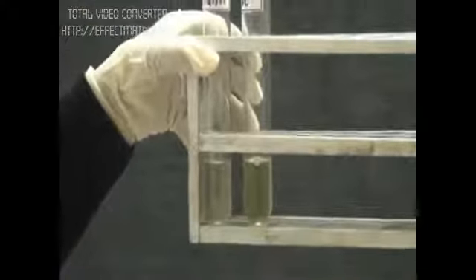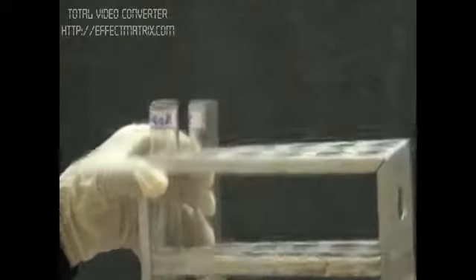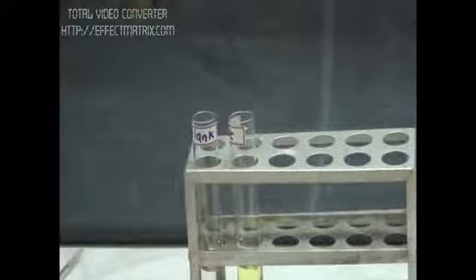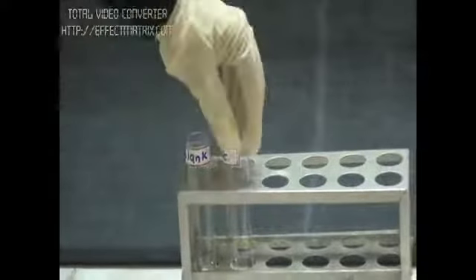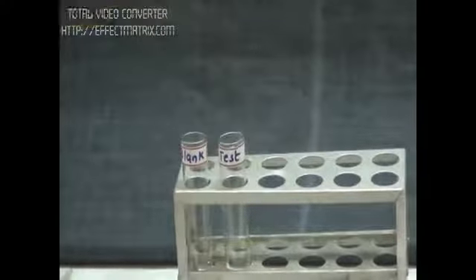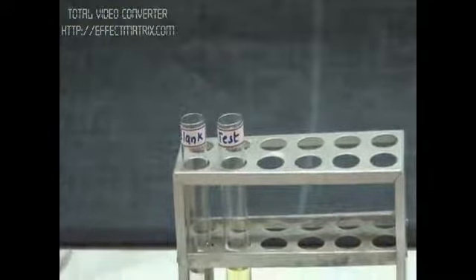No yellow color formation will be there in the blank, and the test will have yellowish color. Now we can check the OD of these tubes at 410 nm. As we have prepared the standard graph, we can calculate the concentration of our product, PNP, formed in our tube, and calculate the enzyme activity.